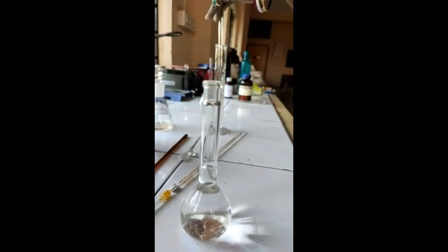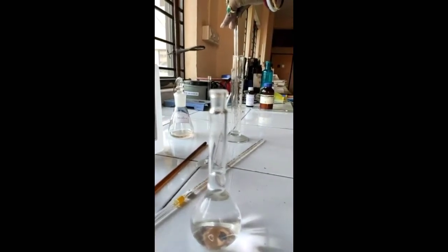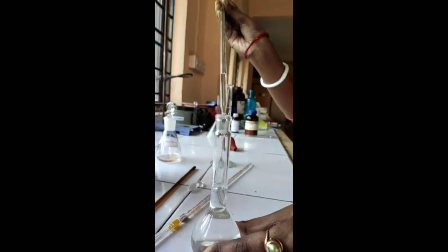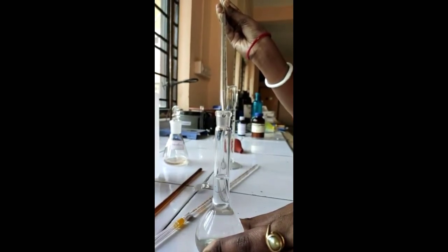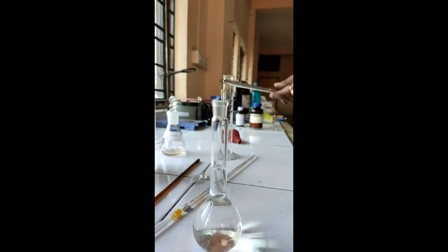Finally, the volume was made up to the mark by filling the rest of the amount with alcohol using a pipette. The make-up volume is now almost done and complete.